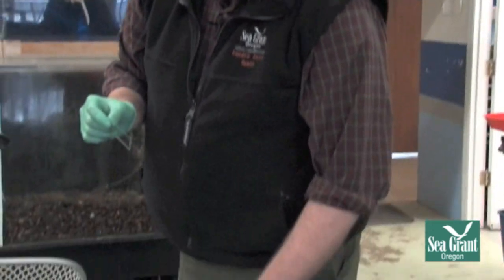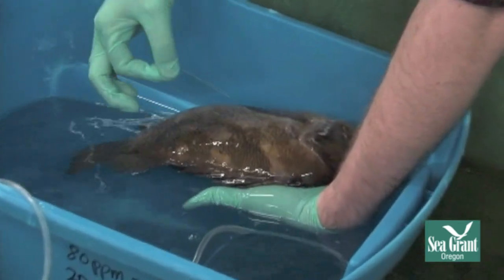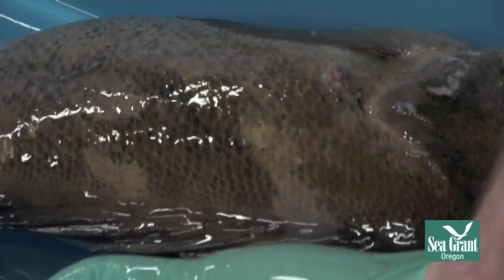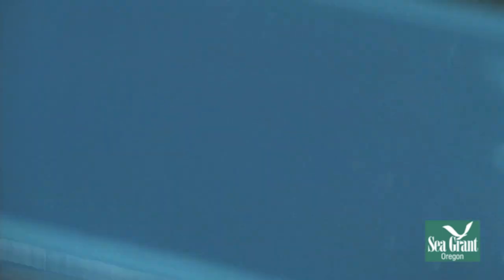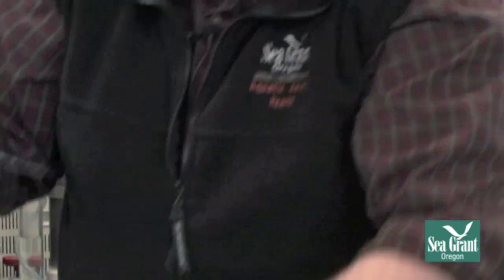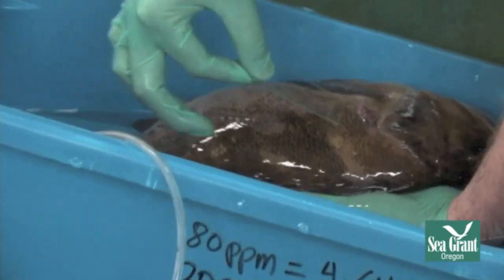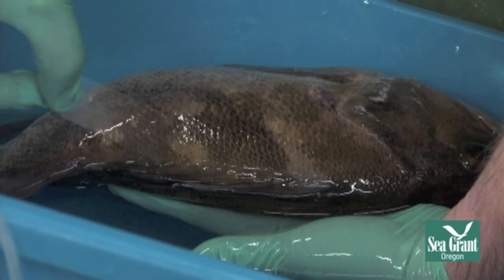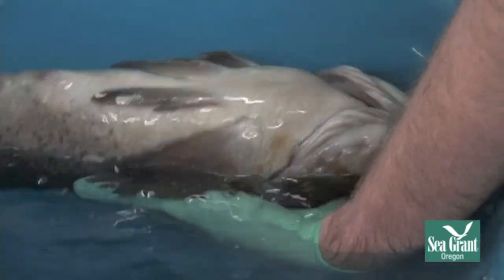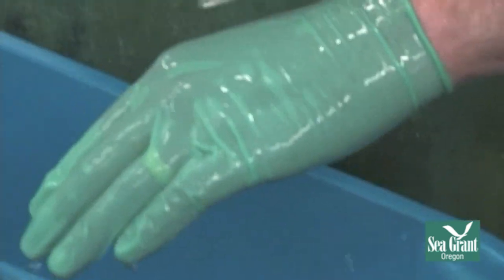When you're doing the skin scrape, you're scraping the fish along the skin. We have the slide at about a 45-degree angle to the skin, and we're pushing down about the amount of weight we'd use if we were writing with a pencil. I scrape along the lateral line, then come up dorsally just next to the dorsal fin, then flip the fish over and scrape along the abdomen.